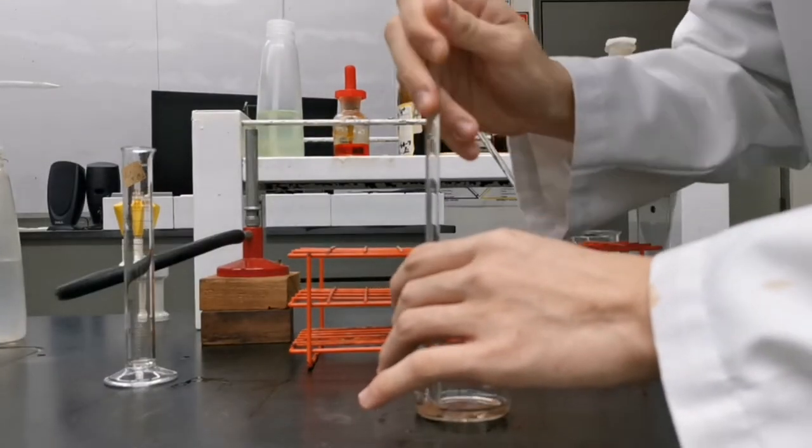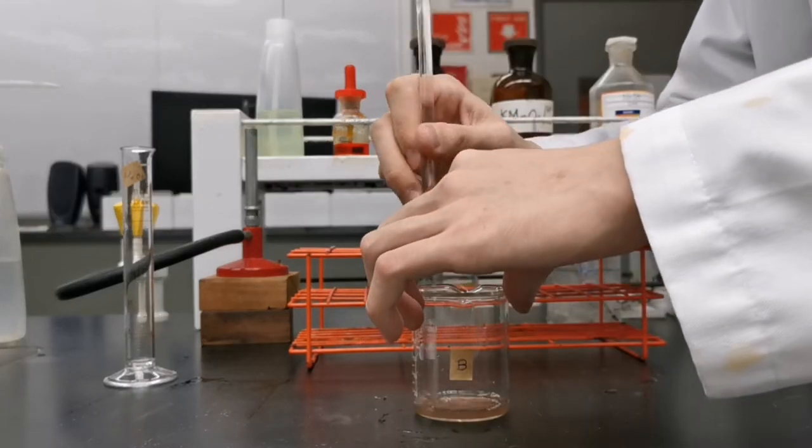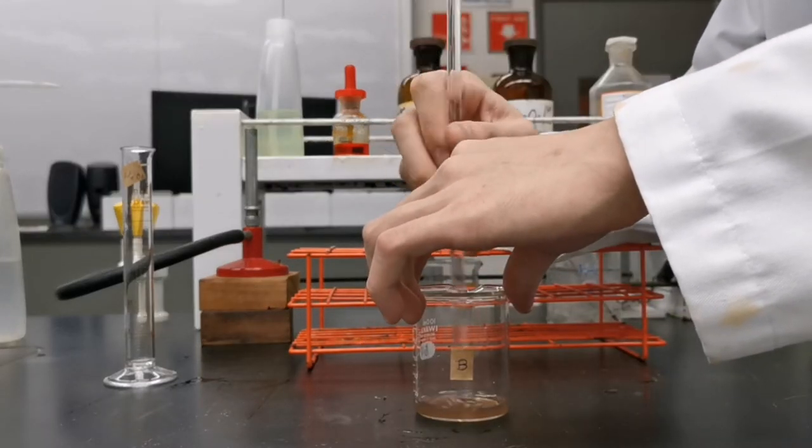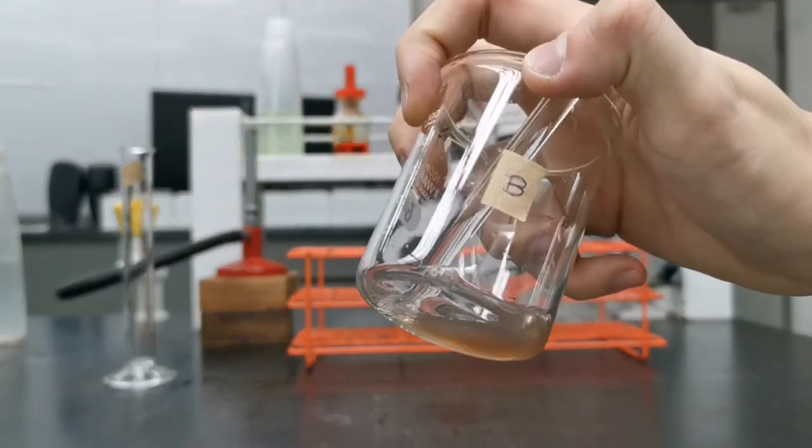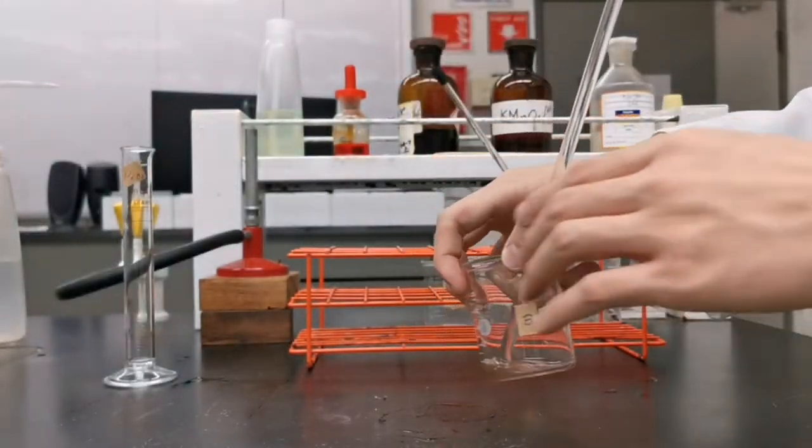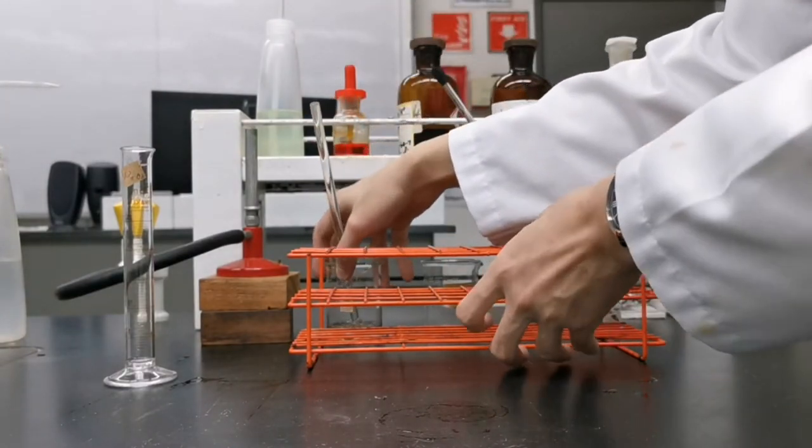It was a huge pain to dissolve all of it completely because the compound is in huge chunks instead of fine powder. After the whole solid has dissolved I then place the whole beaker into another ice bath.